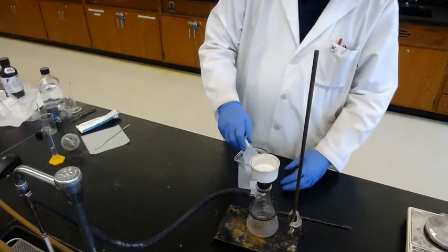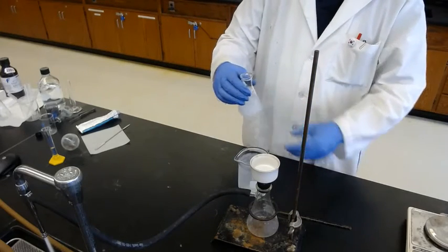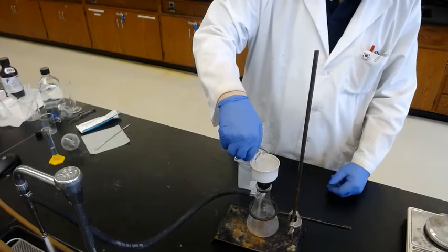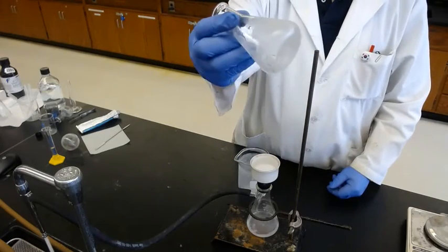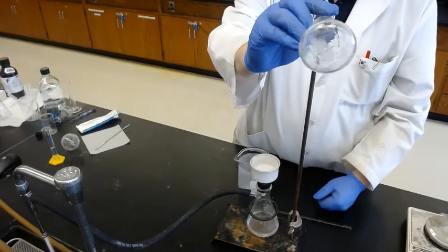And cold enough. Remember, rolling it, quick and gentle transfer. How much is remaining behind? Nothing. Okay.